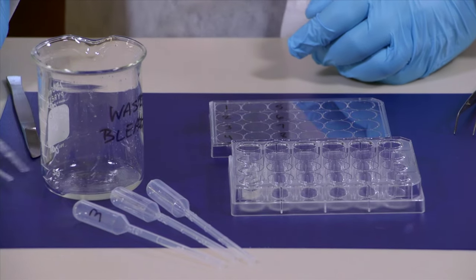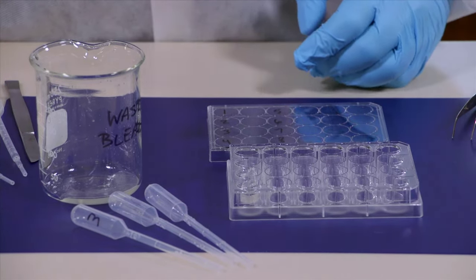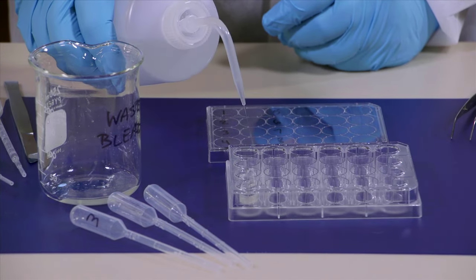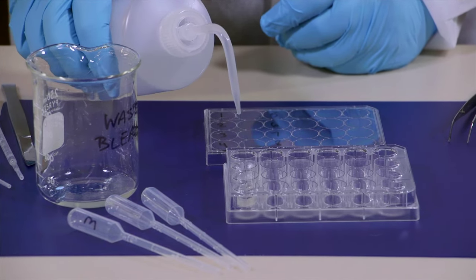Once you remove the bleach just add some water to each well and you want to let this sit for about 10 minutes for those spicules to settle back down to the bottom of the well.